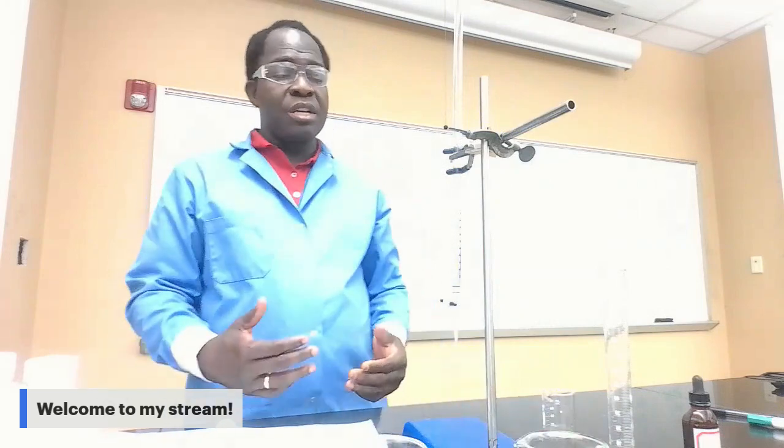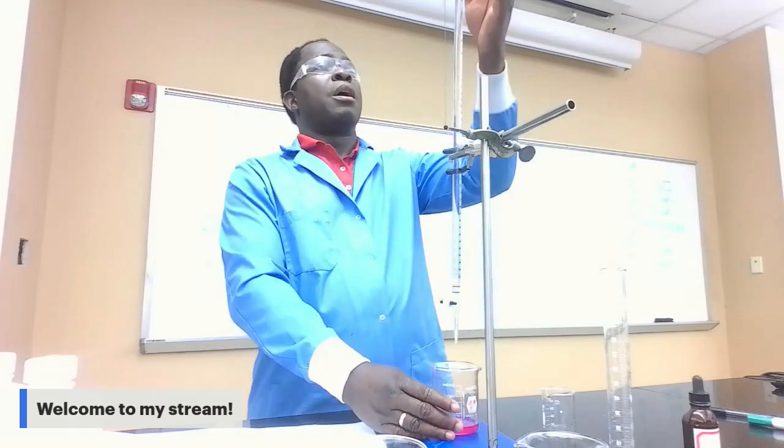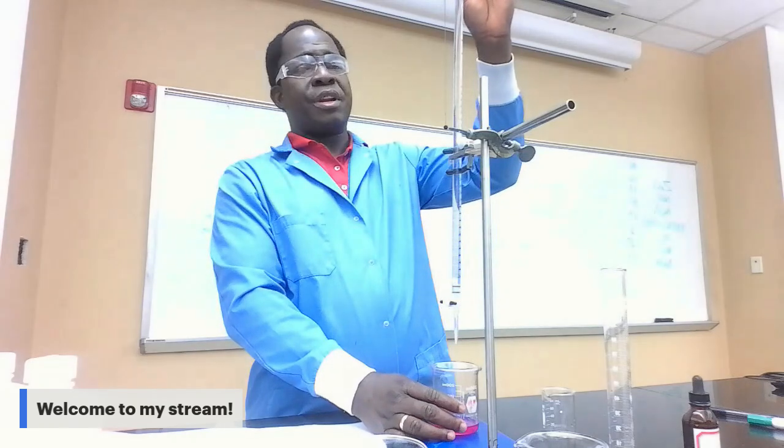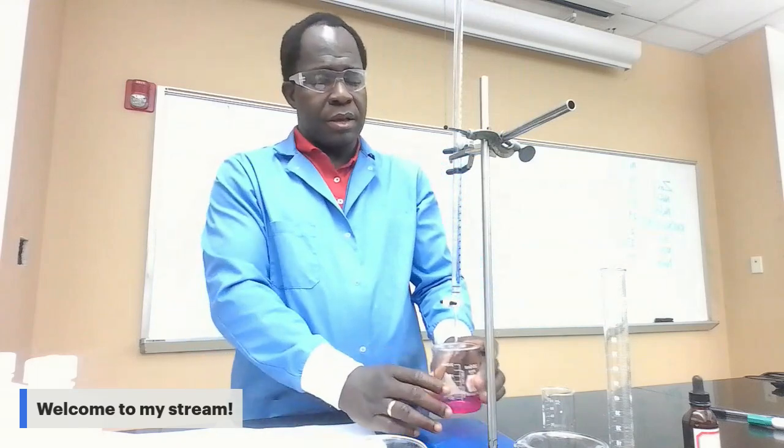Okay. Now we're gonna proceed to the titration. So you're gonna titrate each solution with HCl. You get your beaker to the burette, and you have to start dropping the HCl by increments of 1 milliliter. Any time you drop 1 milliliter, swirl the solution in the beaker to make sure it mixes. You get a good mix.